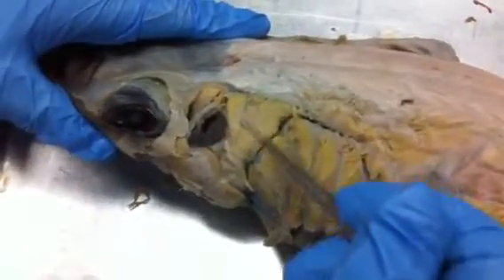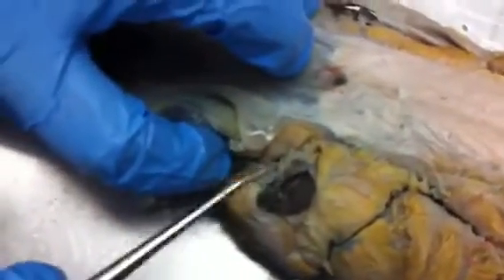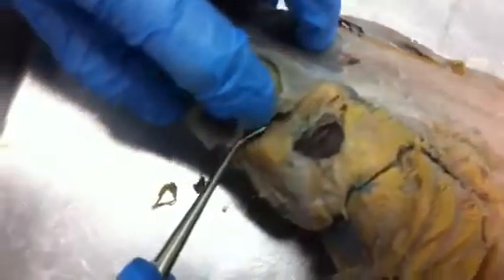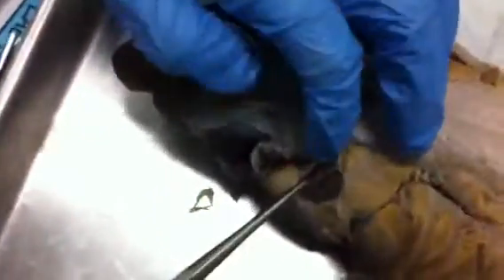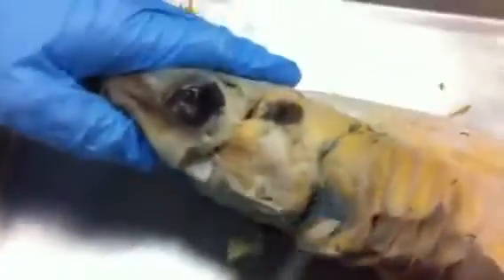and then the one right next to it is the levator hyomandibula. And then the one that runs from the front of the spiracle down to the eyeball, past the eyeball to the mandible, that's the palatoquadrate, which is the upper part of your mandible. That is the levator palatoquadrati. And then this muscle right here underneath the spiracle, you can't really see it all that well because ours sucks, but this is the spiraculus muscle or something, and then this big chunk right here is the adductor mandibulae.